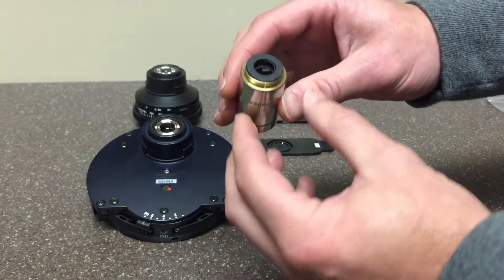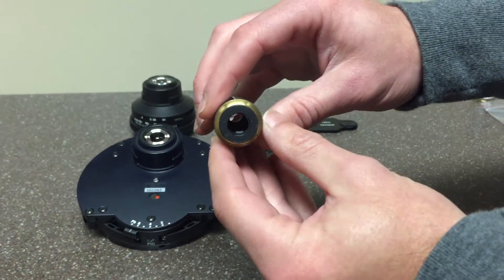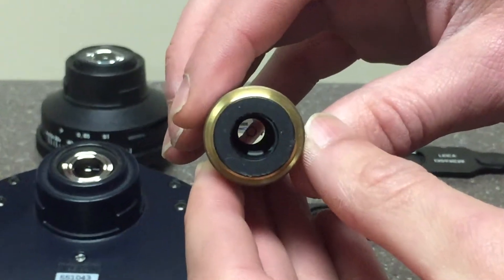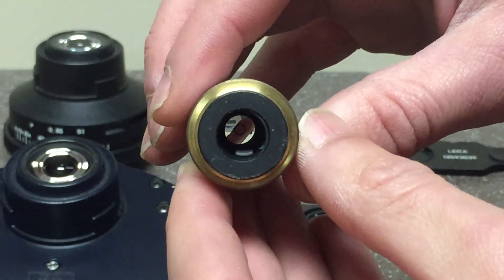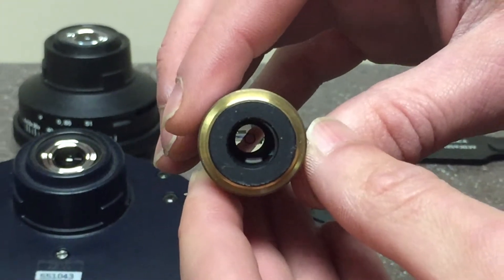A phase contrast objective will have a ring inside of it, and this ring will match up to that phase annulus that you engage.